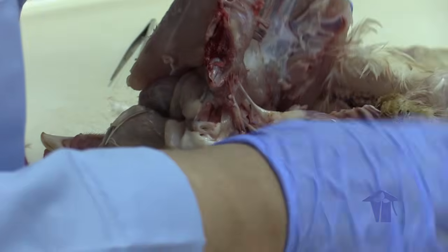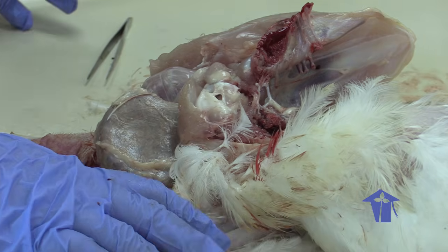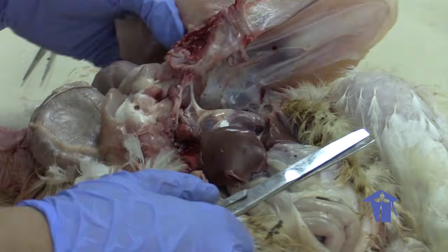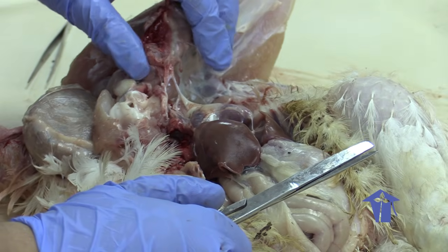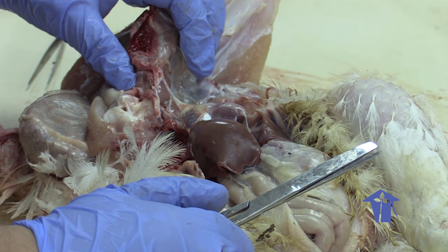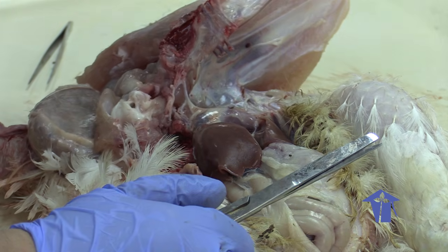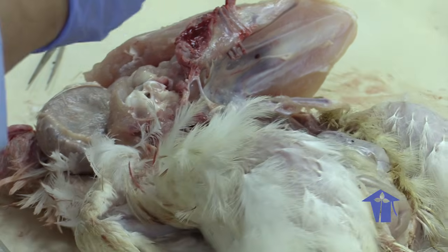One thing that I would like for us to appreciate is how neatly everything is tucked away in the body. It's not like when you look at dissections or a picture and you see everything neatly arrayed. You have bits of connective tissue covering the important parts.